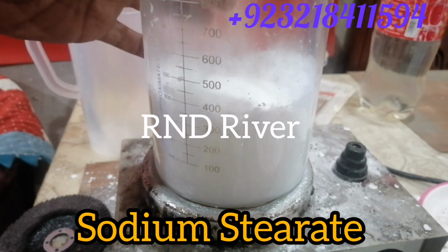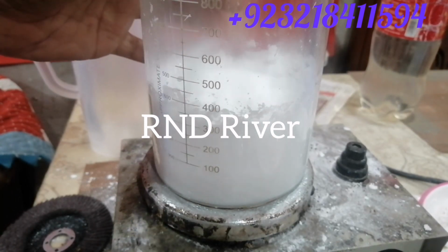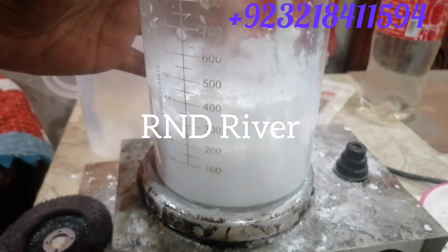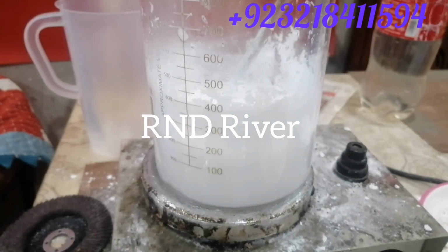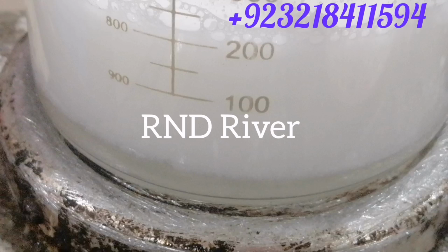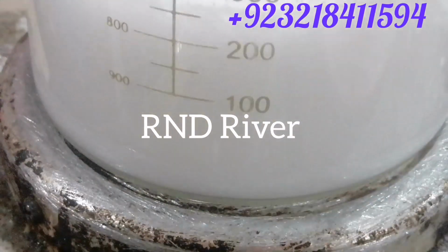When you add the sodium carbonate solution to the stearic acid, the reaction will start. All the material will swell. After the reaction has started, raise the temperature to between 95 and 100 degrees centigrade. Look, as the temperature increases, the reaction goes faster.